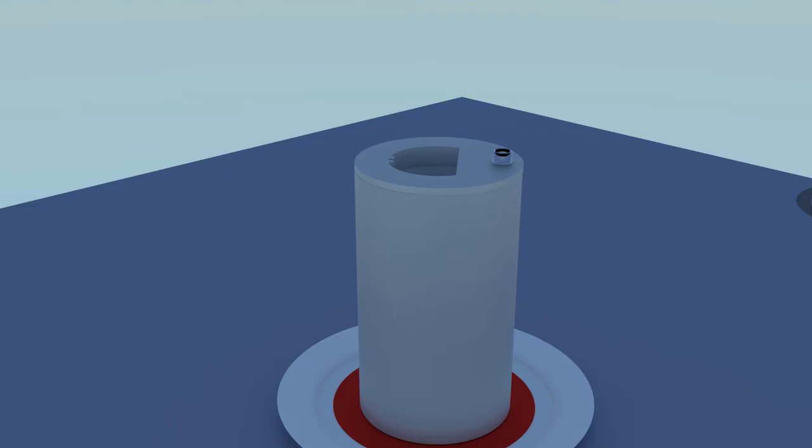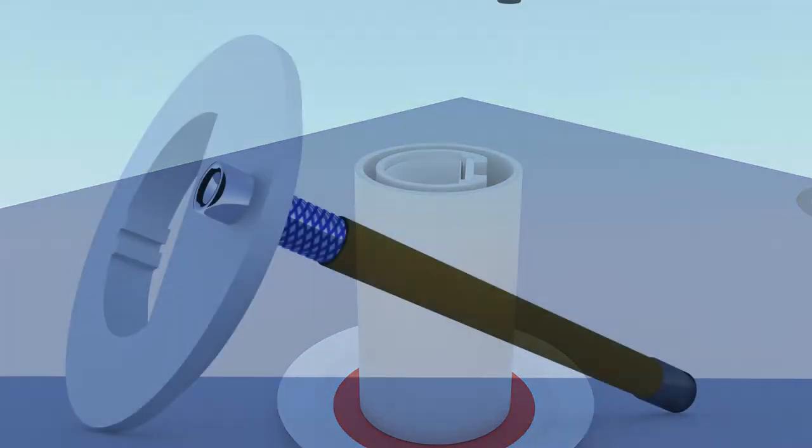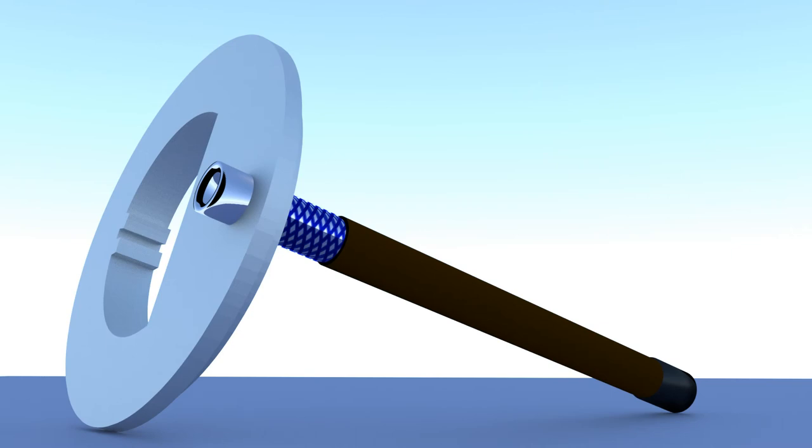Remove the cathode cap and put it aside. Because of variations in the pores of the molecular sieve, some of the smaller metallic atoms like copper and zinc will pass through the sieve and plate onto the cathode. So it is common to see a brown film on its surface. This film will have no effect and can be either left on the cathode or wiped off.